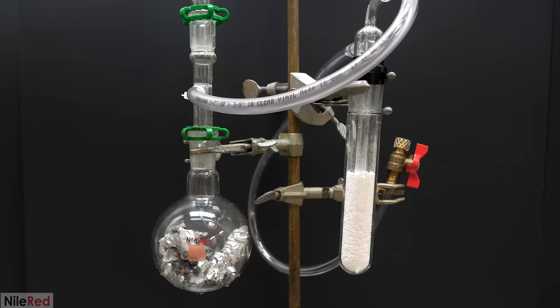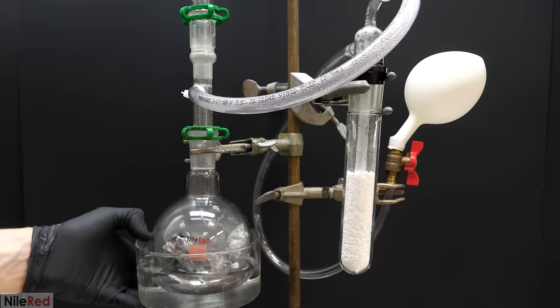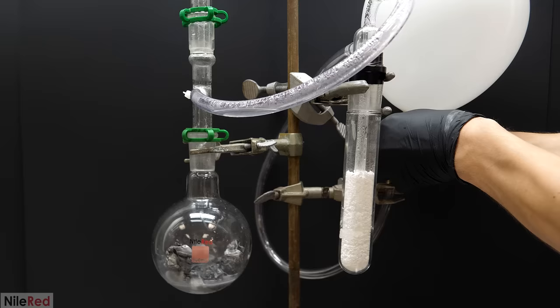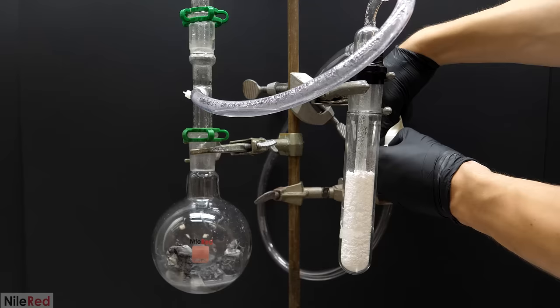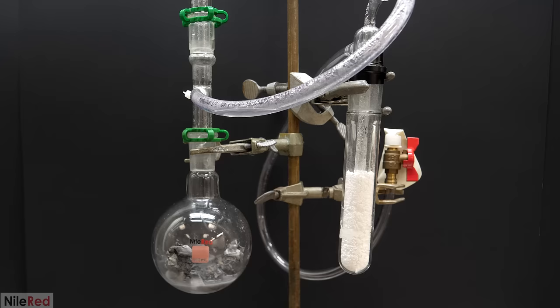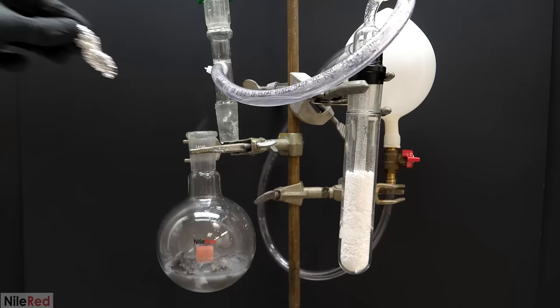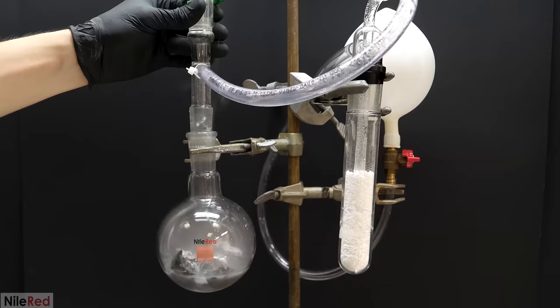The calcium chloride is a dehydrated salt and it'll pull a lot of the water from the hydrogen as it passes over it. This will by no means completely dry the hydrogen but it should take away most of the moisture. After generating a decent amount of hydrogen and letting all of the air get pushed out of the system I attached a balloon. When it got to a decent size I took it off and I sealed it by just wrapping it around a glass stopper. Then I attached another balloon and kept collecting the hydrogen. One thing that I do want to mention though is the major downside of this reaction which is that aluminum and sodium hydroxide generate a lot of heat when they react.